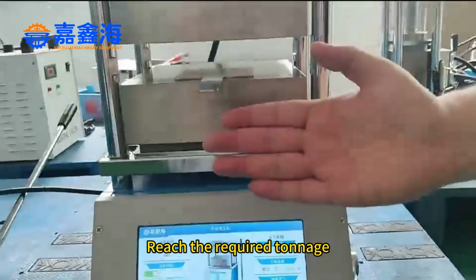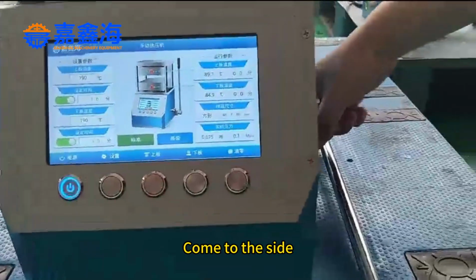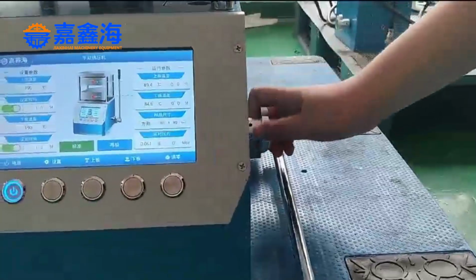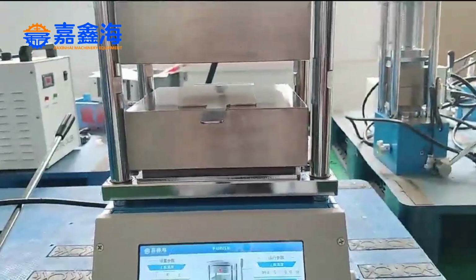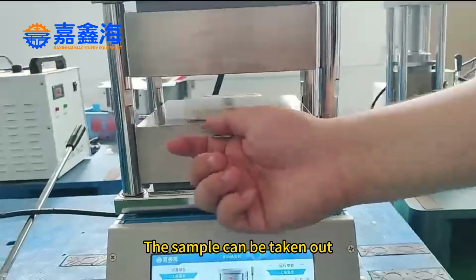Reach the required tonnage. How to relieve pressure? Come to the side and loosen the valve. After loosening, you can see the platform go down, which represents pressure relief. After pressure relief, the sample can be taken out.